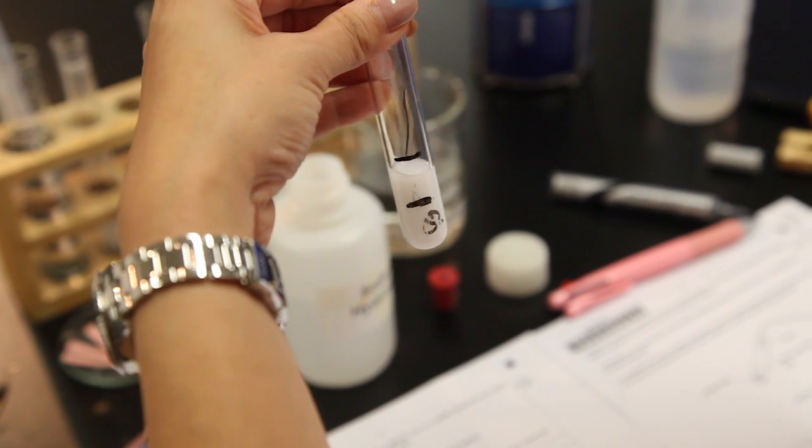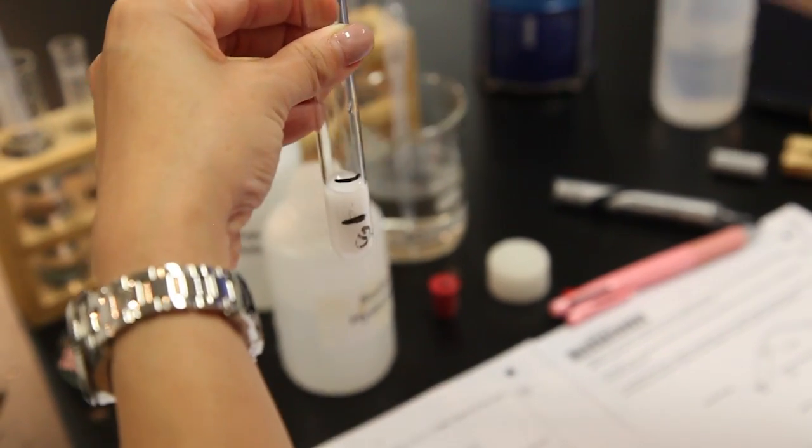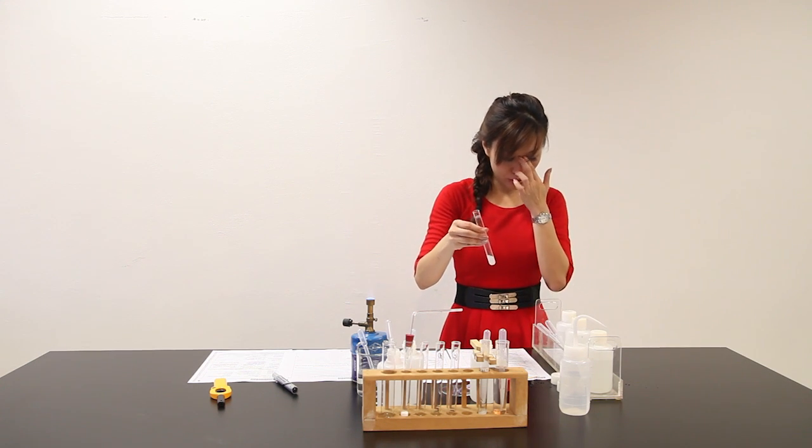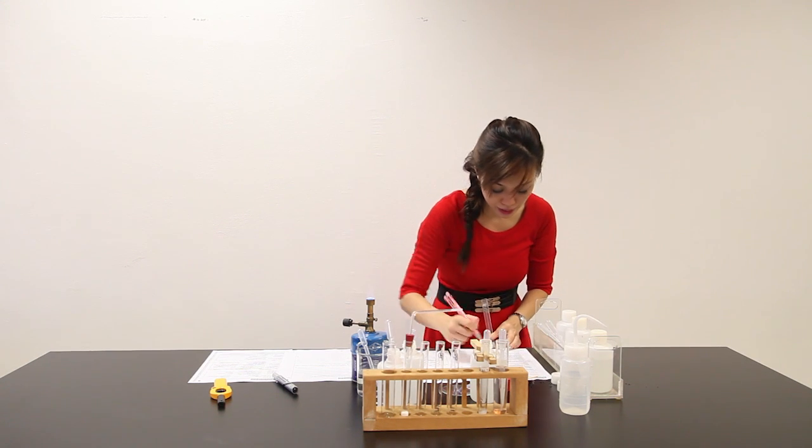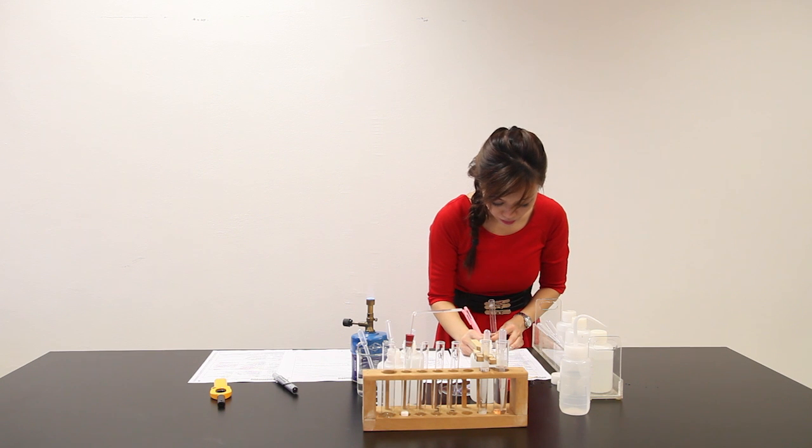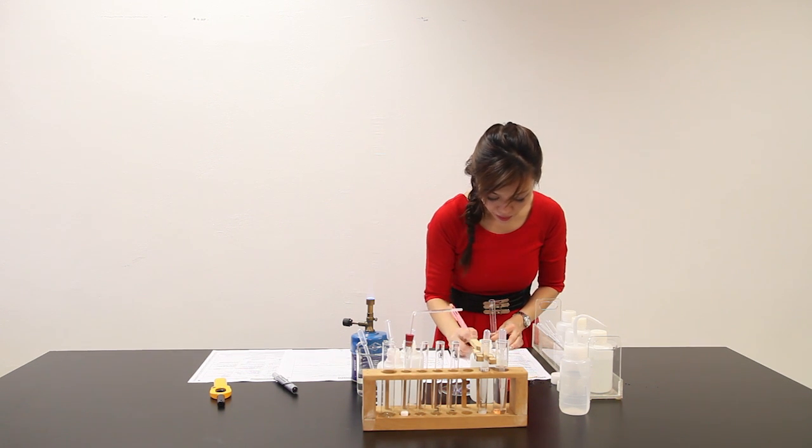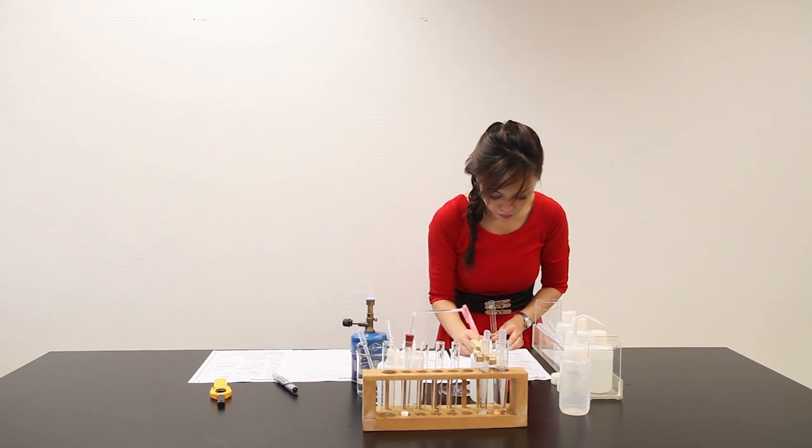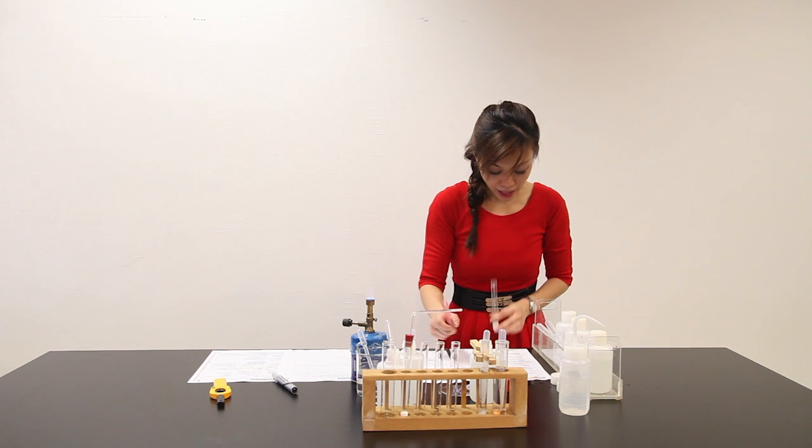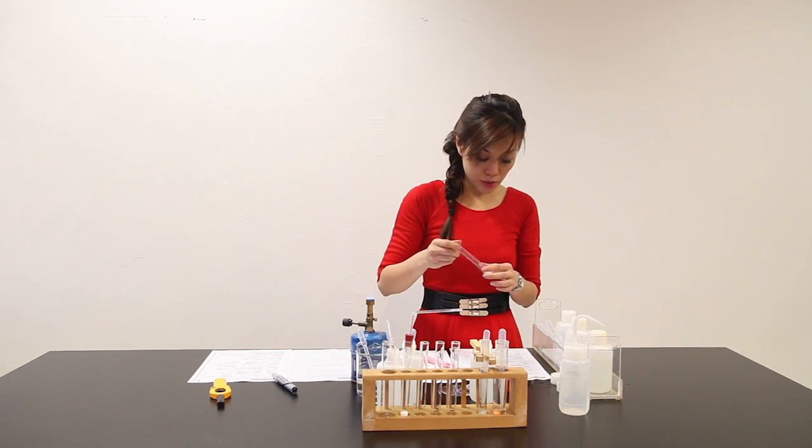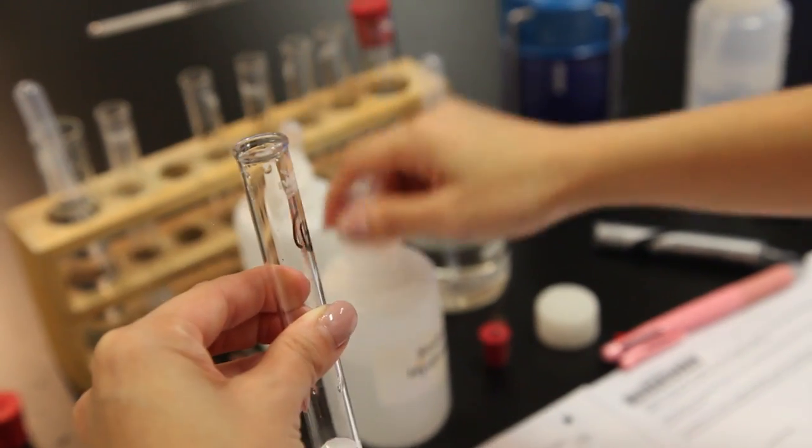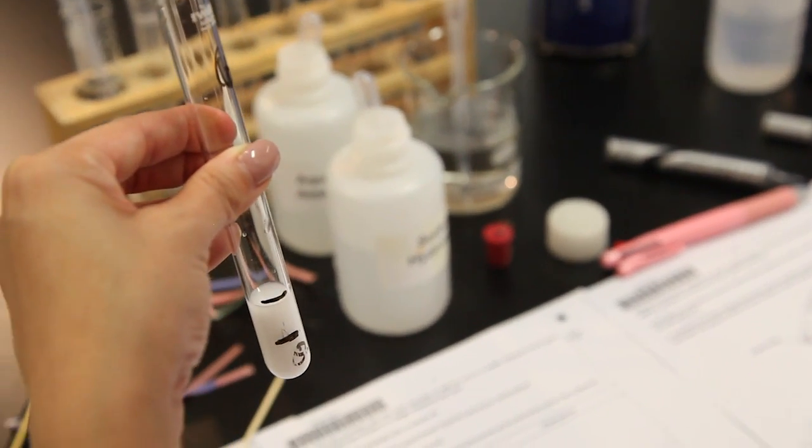As I add sodium hydroxide, white PPT is formed. Upon shaking, white PPT does not dissolve. Let me write down: upon adding NaOH aqueous, white PPT is observed. After I add 2 cm³ of sodium hydroxide to it, the white PPT still does not dissolve.